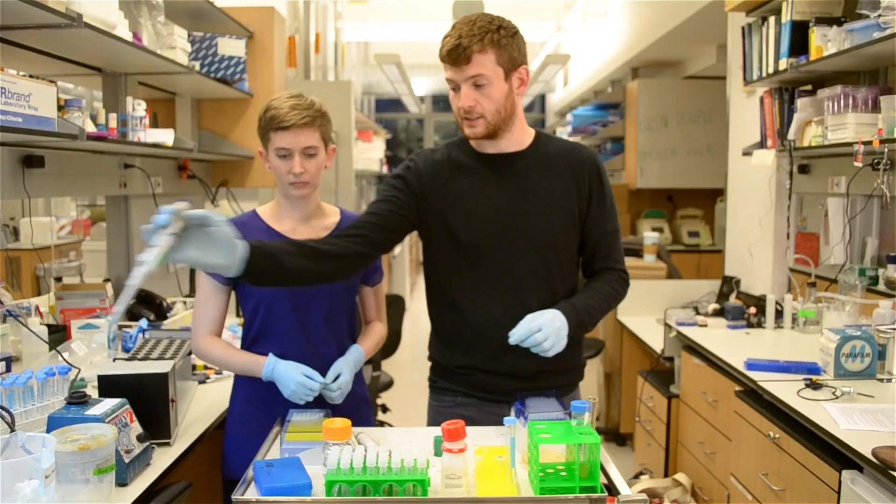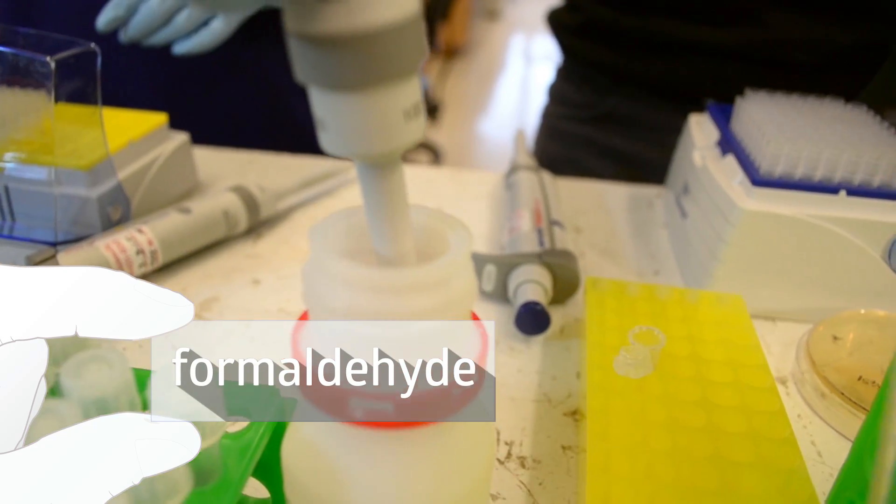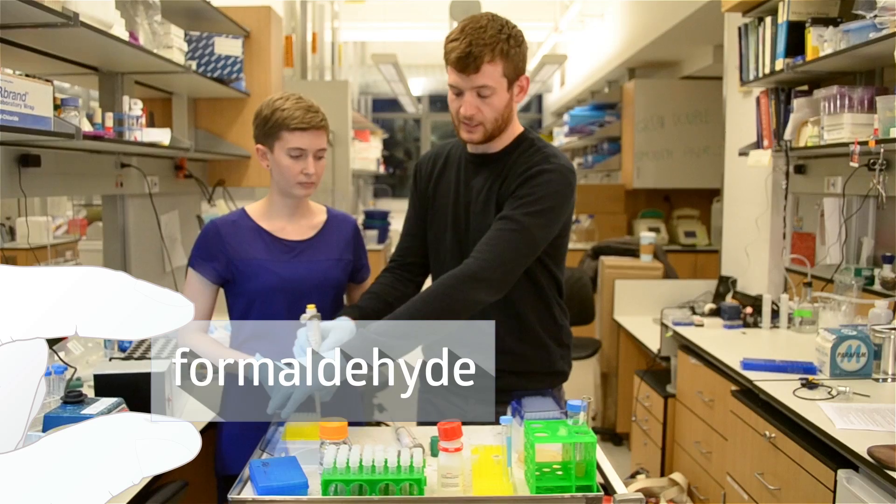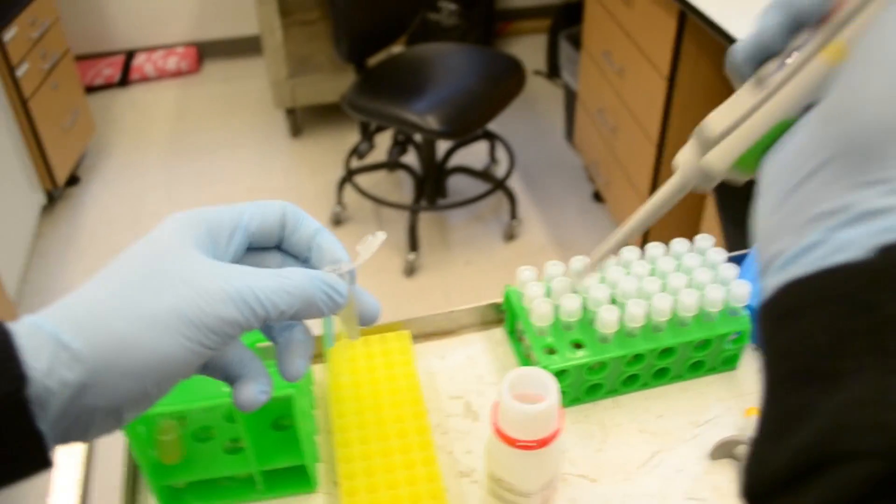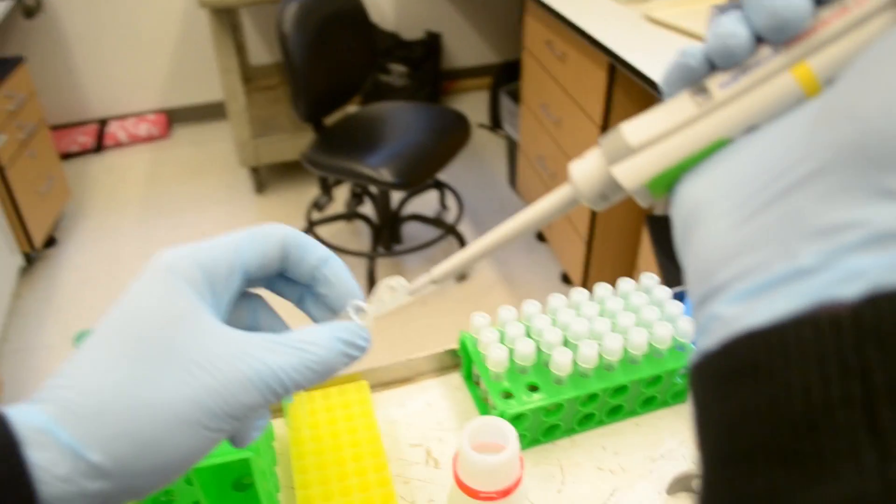The next step is we add formaldehyde. What formaldehyde does is essentially freeze the cells in time and space. Stop time, tell your friends. This means it's going to keep all the proteins and DNA fixed together.